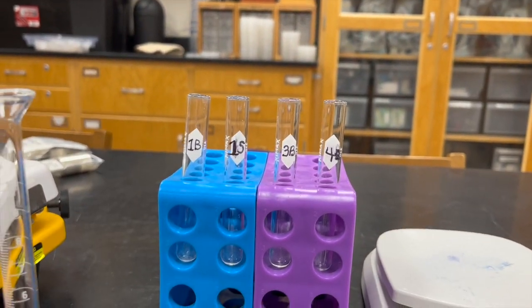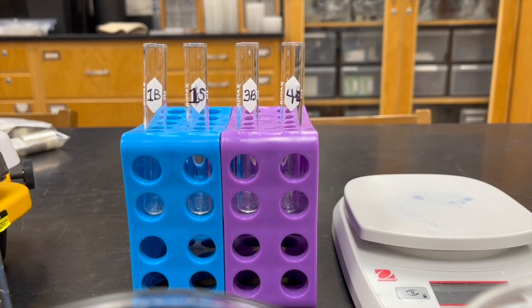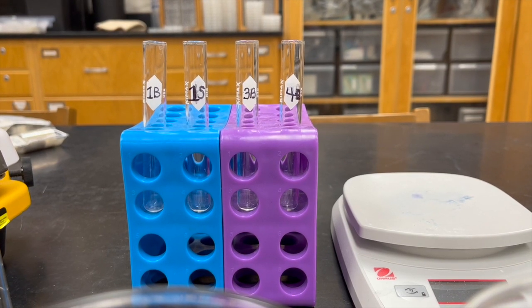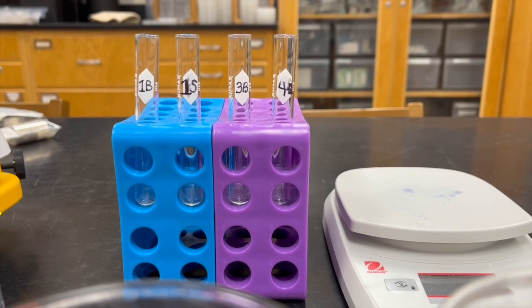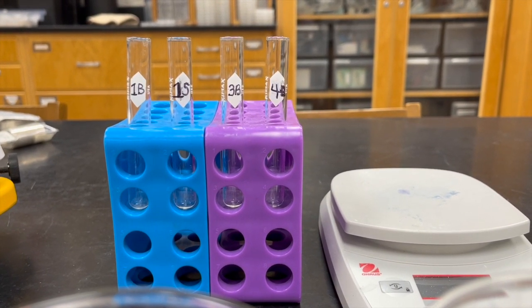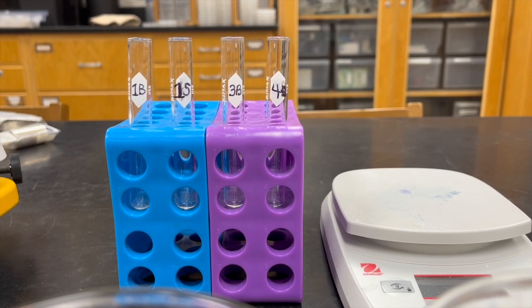So what you should see, 3B for the silver nitrate, you'll see the formation of a precipitate. When there's a color change, that indicates that sugars are present. It'll change from that blue color to either a yellow or a green color.